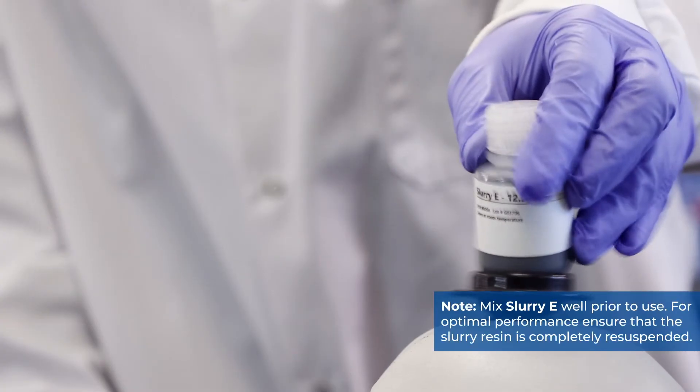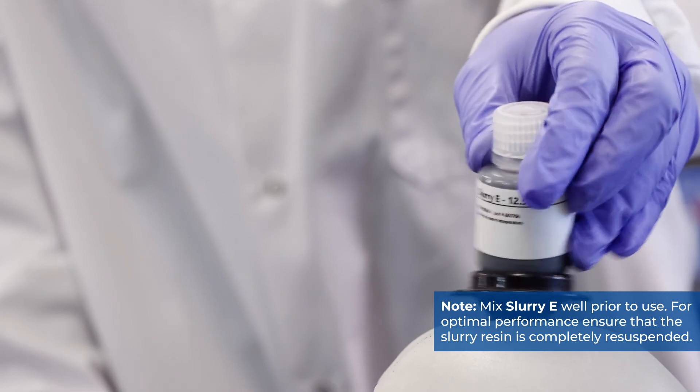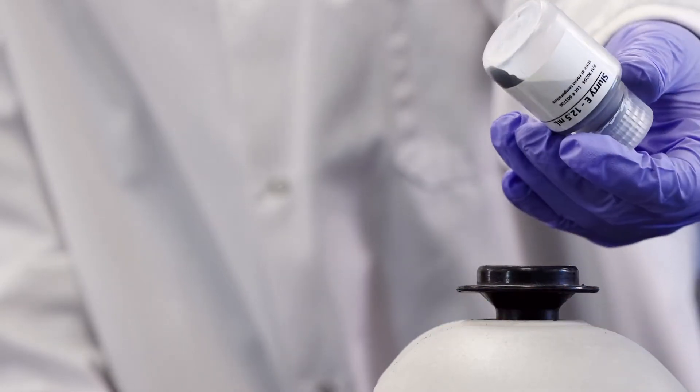Mix Slurry E well prior to use. For optimal performance, ensure that resin is completely resuspended.